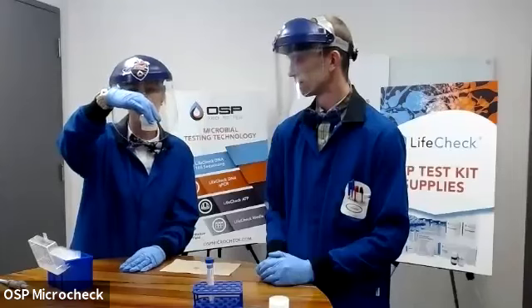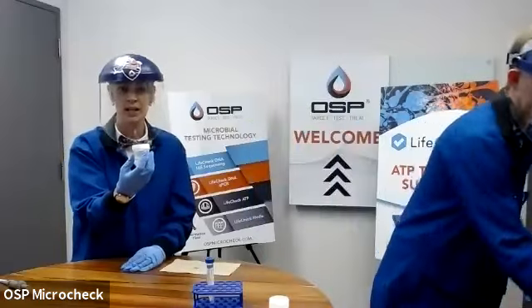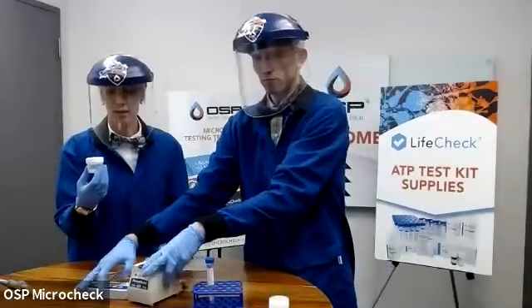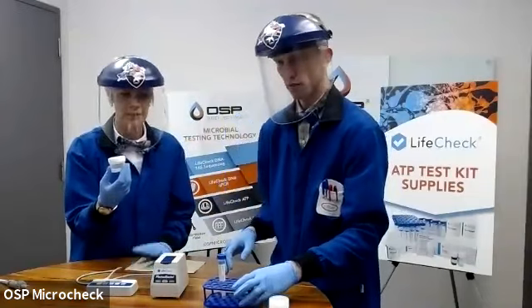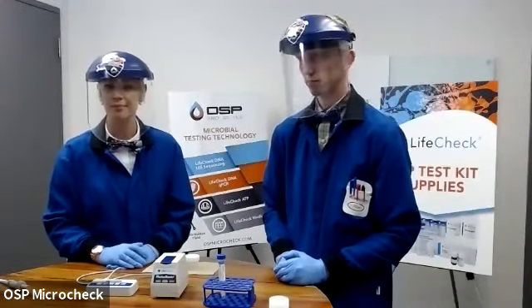And this can stay in cool conditions, not freezing, for 3 days, maybe up to a week, if you're doing a lot of sampling, a lot of gathering, and you need to get it back to a central location. And then once we get there, we're going to take the reading. So what we've covered here is the extraction steps. We're going to take a pause, see if there's any questions, and then we'll move on to reading our sample.